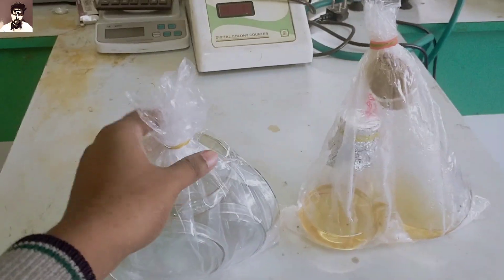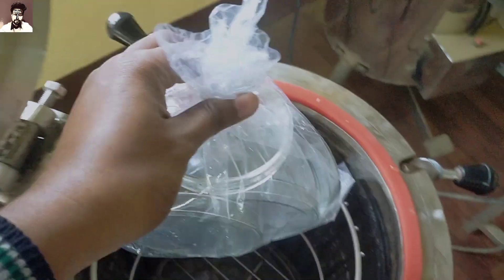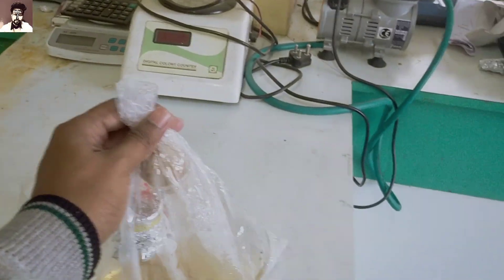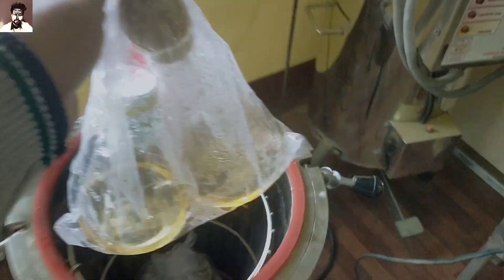Now, in the next step, a glass plate along with the solution will be autoclaved. This sterilization step ensures that any existing bacteria are killed before use.